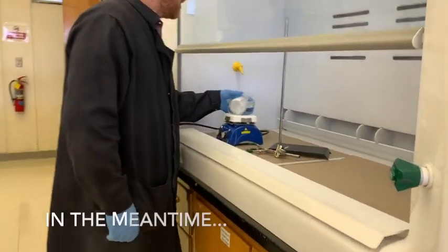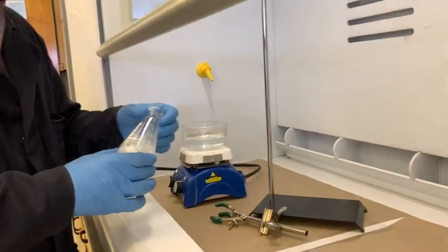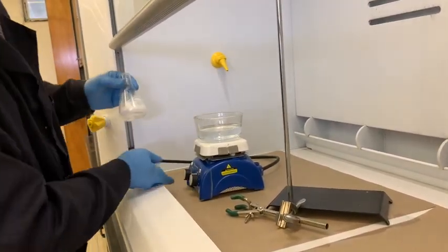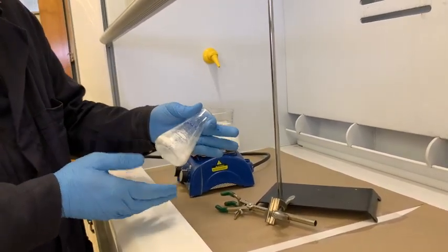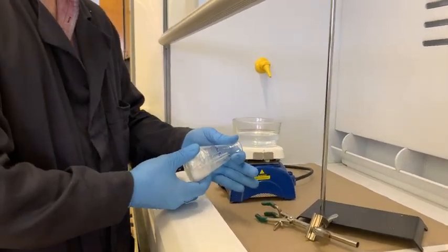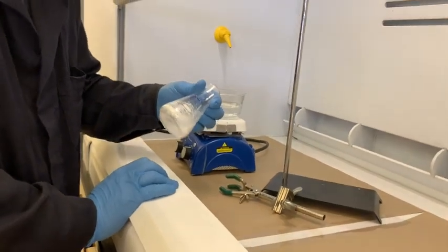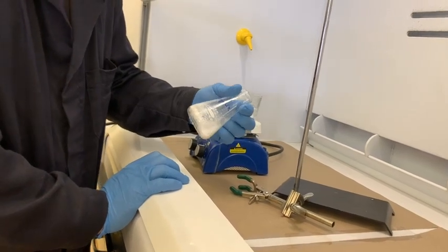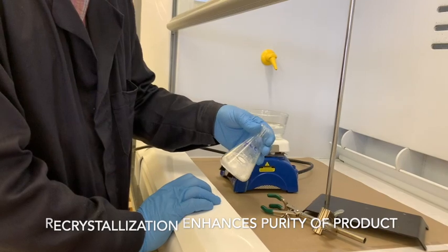The organic DCM solution boiled off pretty quickly and at this point it's bone dry. Because I pre-weighed this flask, I can take the mass now and see exactly how much product was produced — that's going to be our organic unknown. Normally I would recrystallize this on camera, but today I'm going to cut that out and show recrystallization in a future video. The acetylsalicylic acid fell out of solution in the very acidic aqueous solution due to protonating the carboxylic acid on the acetylsalicylic acid, going from the salicylate to the protonated carboxylic acid.